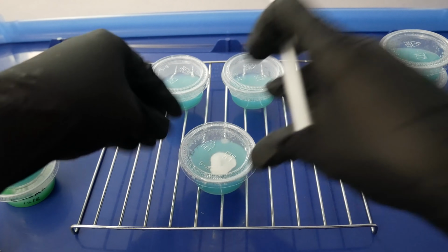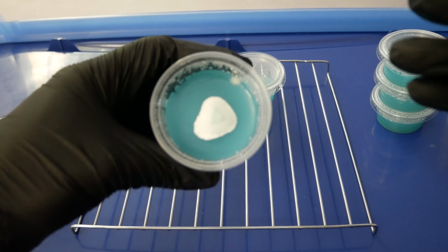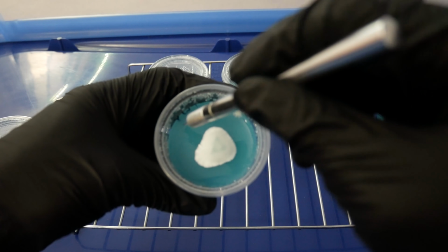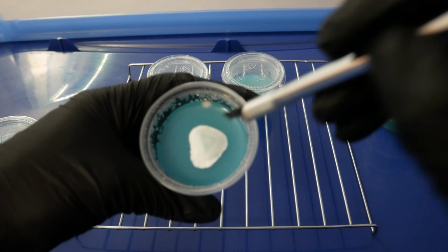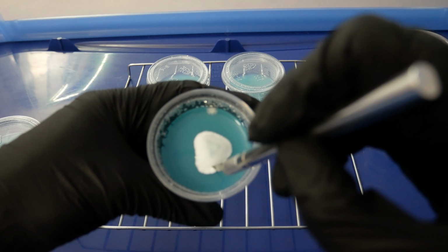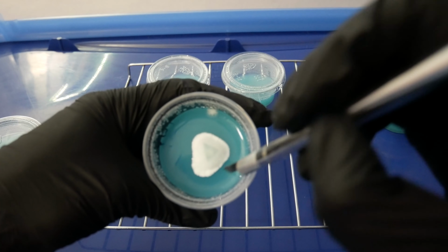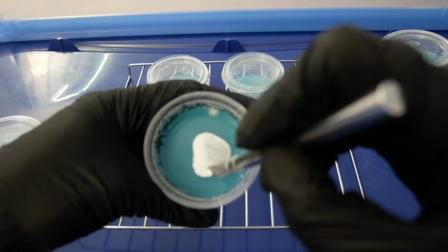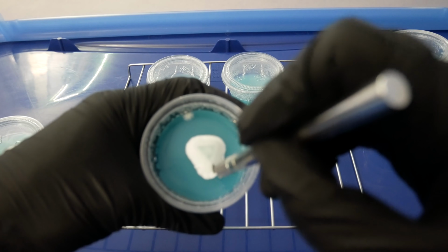To clean up your plates, we want to make transfers until we have a clean culture, completely free of any contaminations. You're going to do this by cutting out a piece of the cleanest, healthiest looking mycelium on a plate and then putting it onto a new dish to colonize. With the clean culture from a colonized dish, we can now introduce the grain and have a much better chance at successfully colonizing the jar. It usually takes about 1 to 3 transfers to get a clean culture.